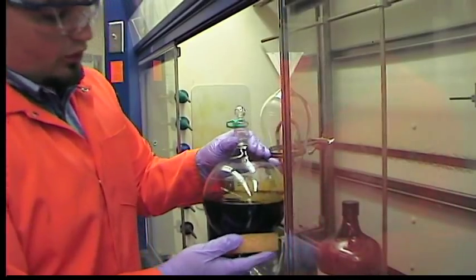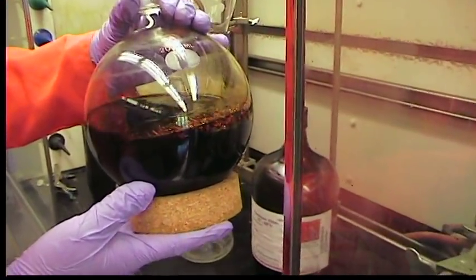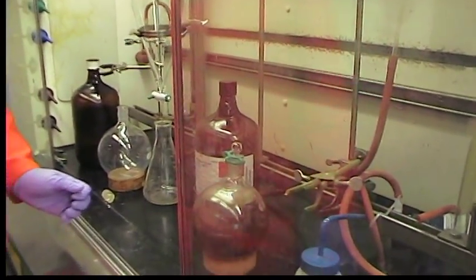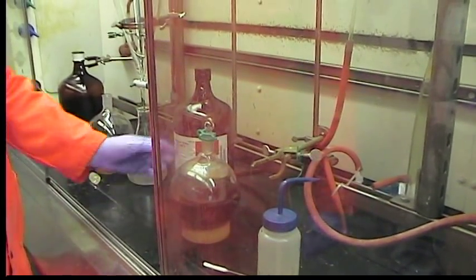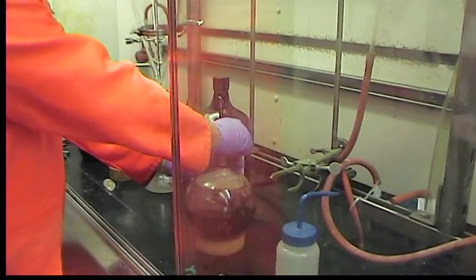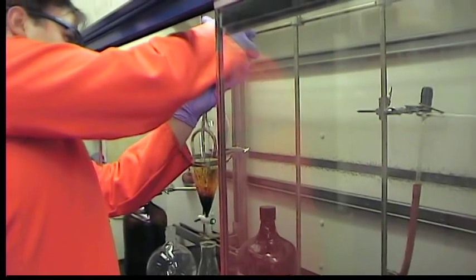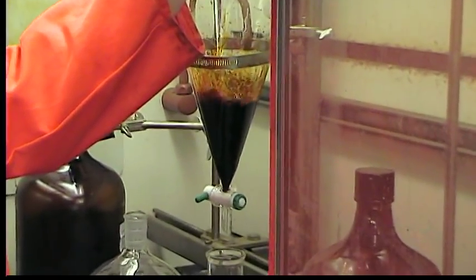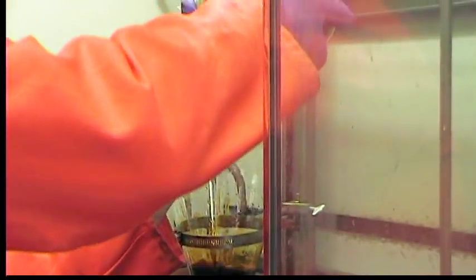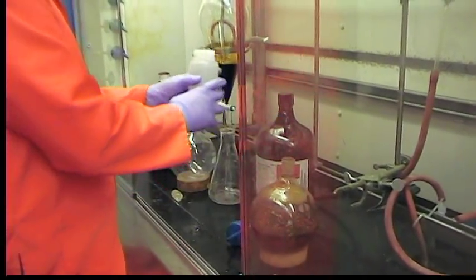We concentrated the amine solution to about a liter. It looks like oily brown-red solid, but leaving overnight generated some crystals that we're going to try to separate. The way we're going to do the separation is just water-petroleum extraction. We're going to try to run this whole liter in about three batches. So we're going to take about a third of it and extract it with something like 800 milliliters of water and petroleum ether.